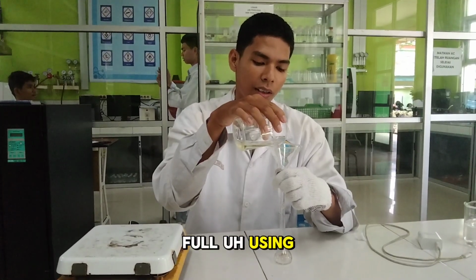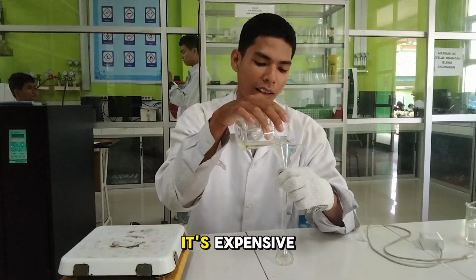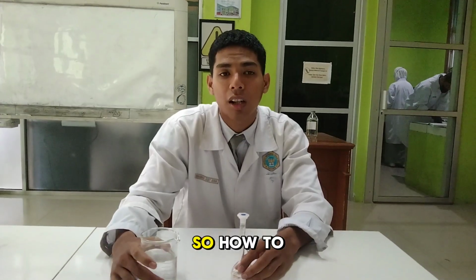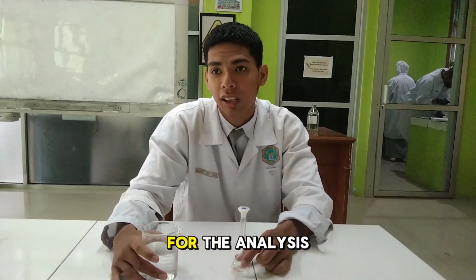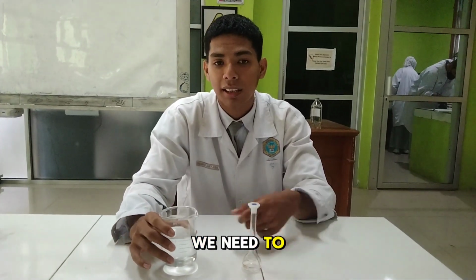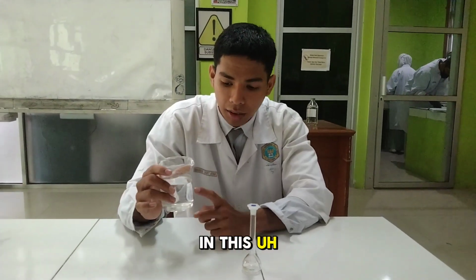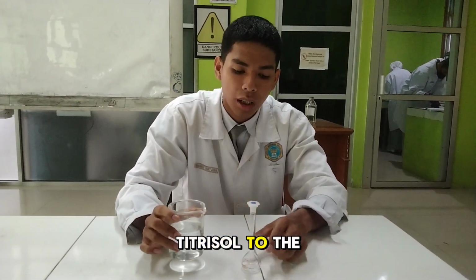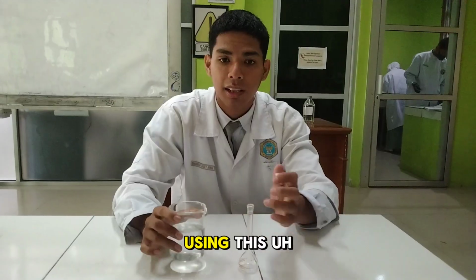Be careful using this tool because it's expensive. To make the standard for the atomic absorption spectrophotometry analysis, first we need the stock of the sample. The stock I use is Cu metal in this beaker, and we pour it into the volumetric flask using this beaker.